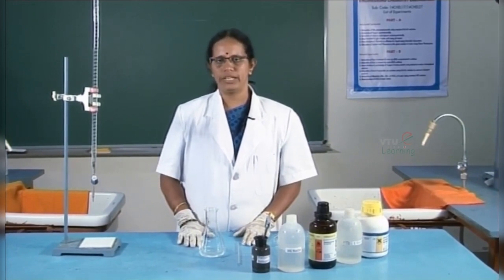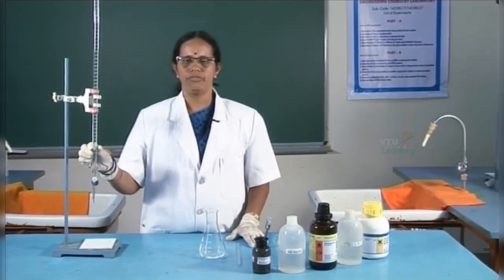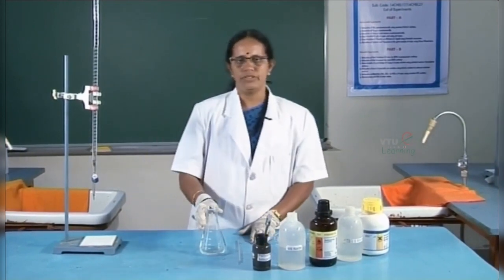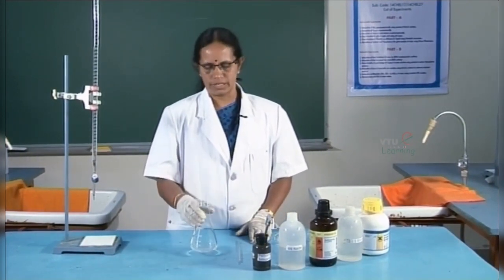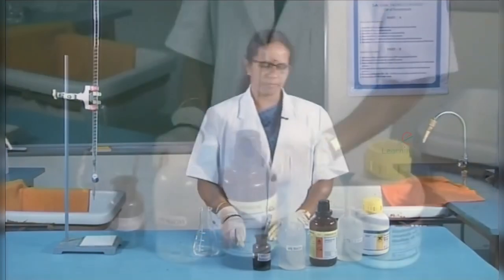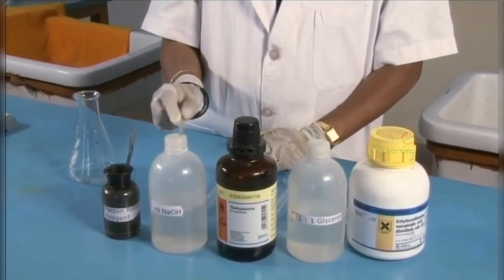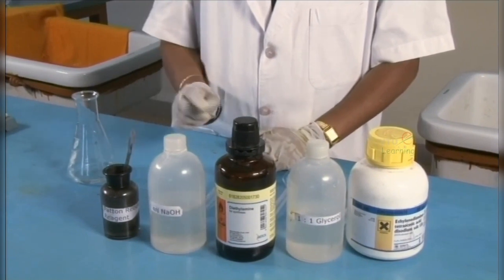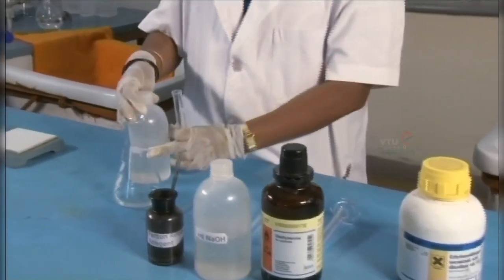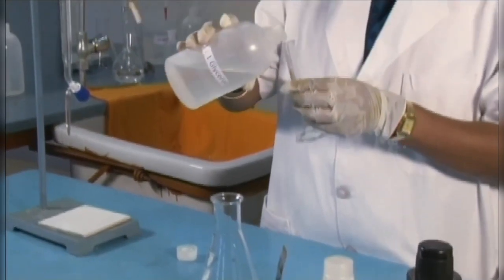Now, the conduction of the experiment. In the burette, I have filled standard EDTA solution. The sample solution has been pipetted out. It is about 25 cm cube. Now, the required reagents glycerol, diethylamine, sodium hydroxide as well as the indicator are added in sequence. Firstly, glycerol. 3 ml of glycerol is added.